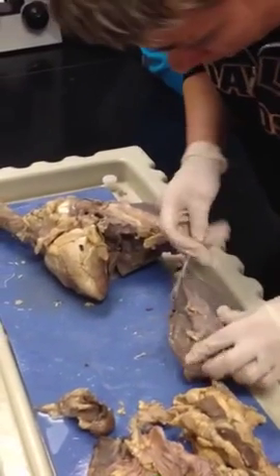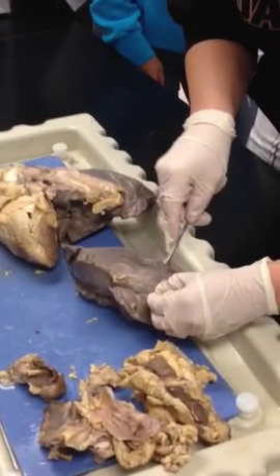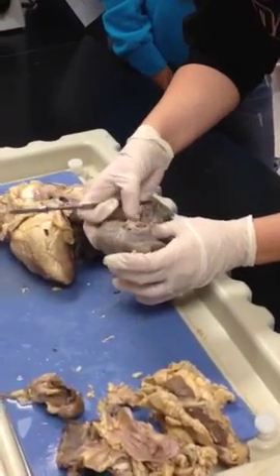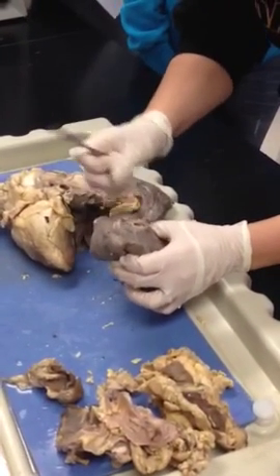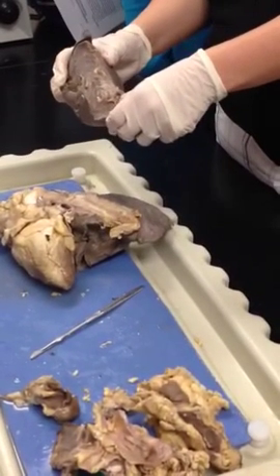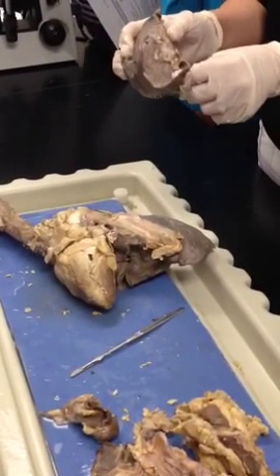Alright, so when you are looking, you have to be able to identify pulmonary arteries and pulmonary veins on the dissection. I'm just trying to trim away so you guys can see better. So what's different about the artery and vein in the lung than the rest of the body? Artery carrying the deoxygenated, right? So it's opposite as far as the type of blood they carry. Oxygenated is carried in the vein. Deoxygenated is carried in the artery when we're talking about the lungs.